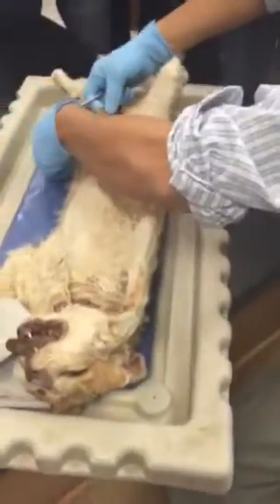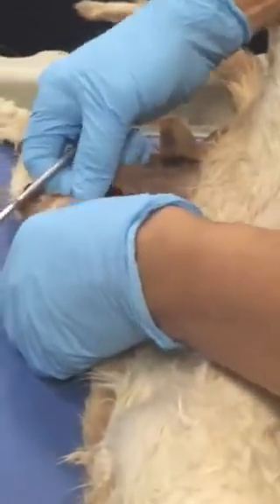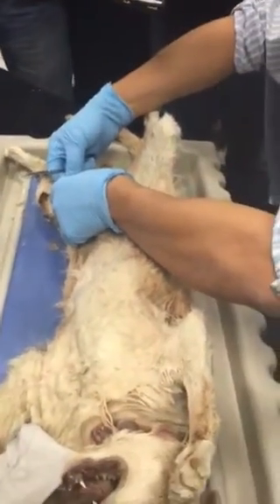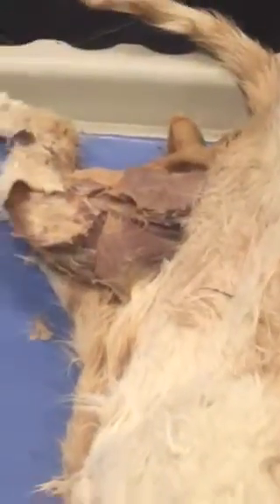So now, these two. You see this muscle here, this is being cut. This one is also cut, but the other part, I couldn't find it. Maybe it's kind of like part of this, I guess. Do you see that? But the other part is missing. So these two muscles are the medial superficial muscles.